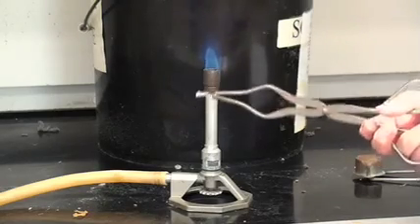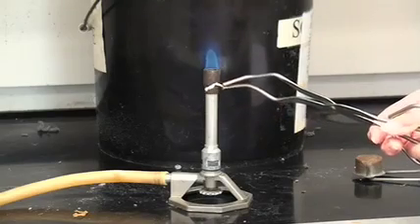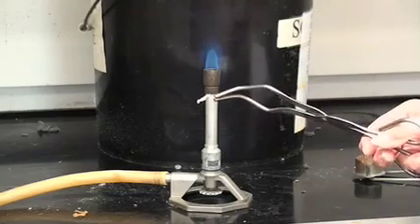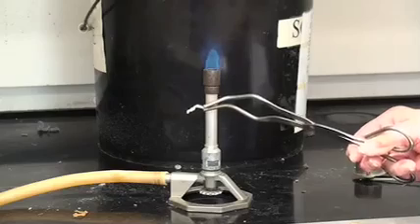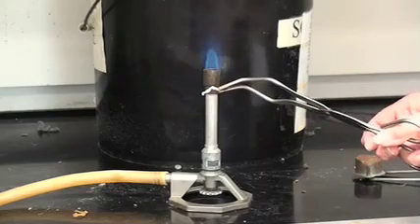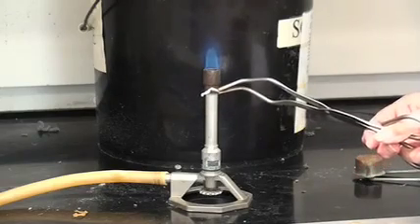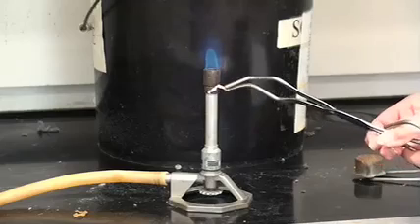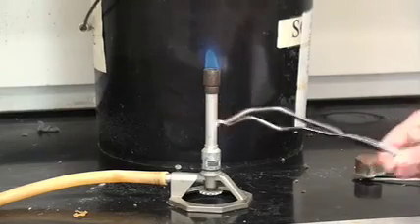Clearly, it was highly reactive. I'm going to now confess that I had actually started to burn it a little bit before we showed this demo just for you to be able to see how quickly the flame was observed.